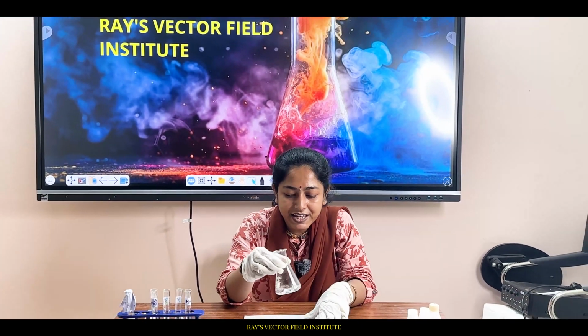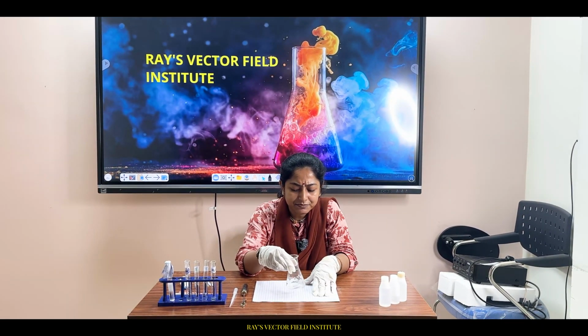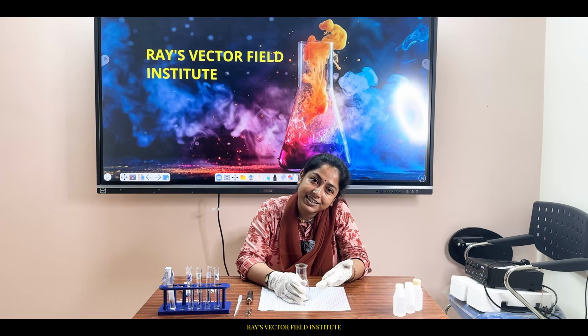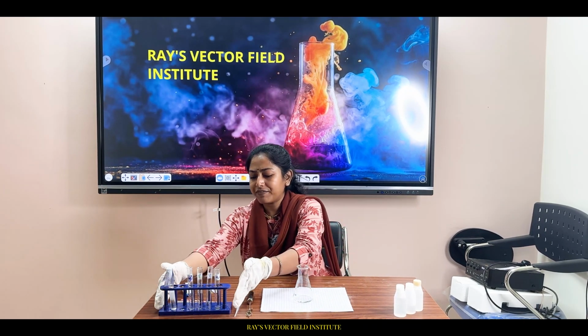Now what you will be seeing is an acid-base reaction. What does it mean? How can we explain any sample as an acid? Those substances that liberate hydronium ions in aqueous solution are known as acids. And the opposite ones, bases or alkalis, are the chemicals that liberate hydroxyl ions in aqueous solution. Whatever chemicals I needed to add, I have done.